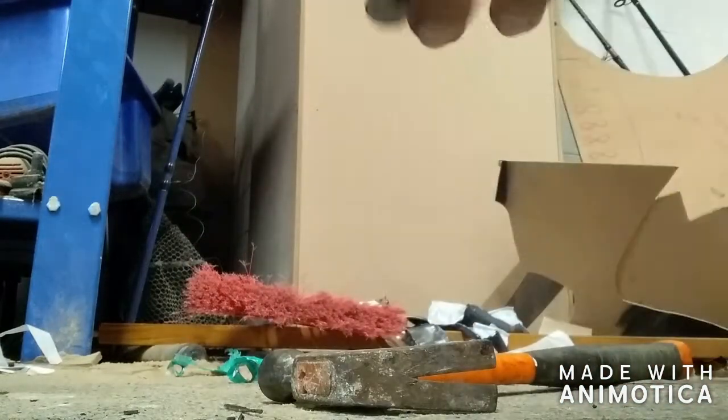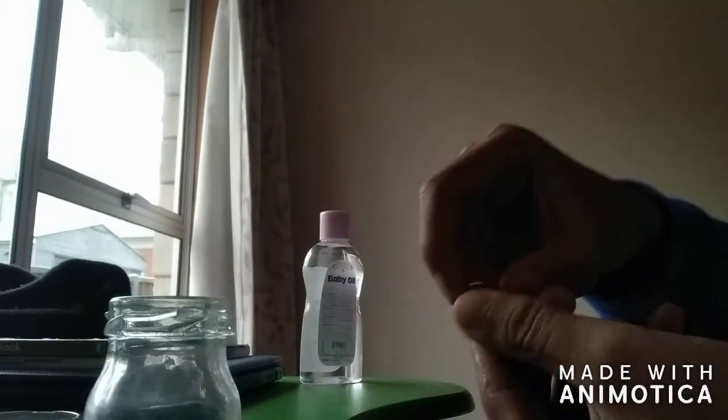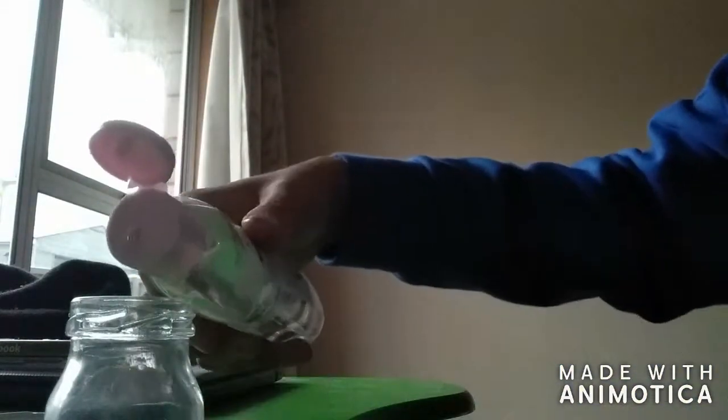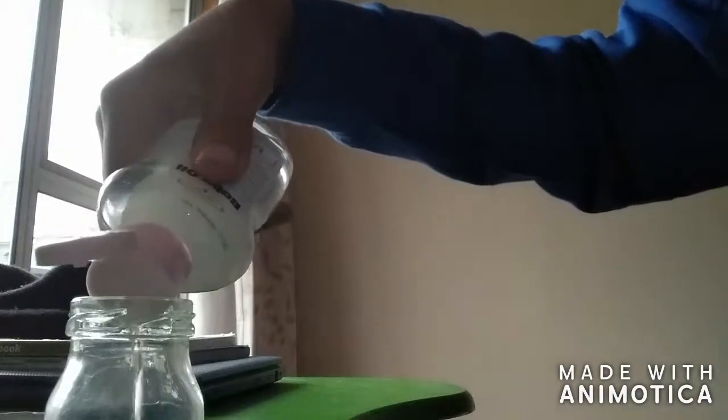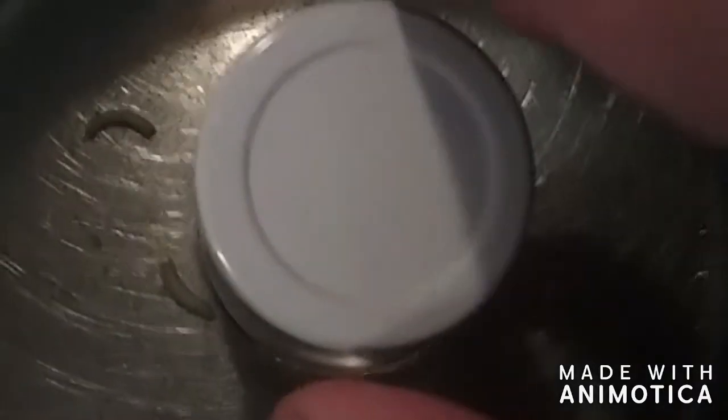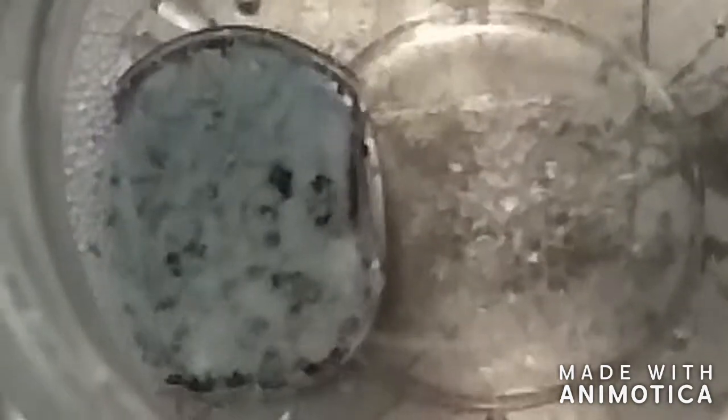Here's the lithium that we've been looking for. I'm going to try putting the lithium in a glass jar with some mineral oil so that I could potentially melt the lithium without using any hardcore nitrogen flushing. The baby oil boils at about 260 degrees Celsius, and the melting point of lithium is about 180 degrees Celsius, so I don't have to worry about the baby oil boiling.